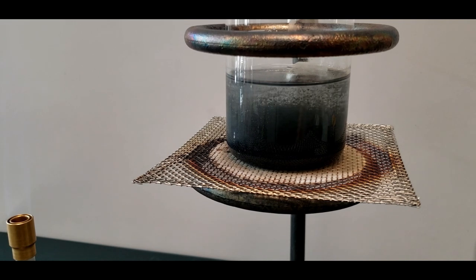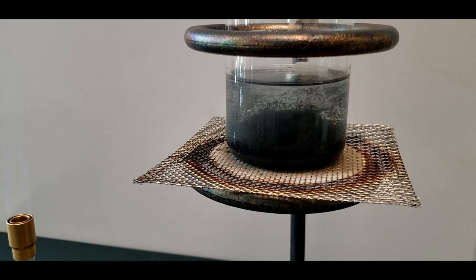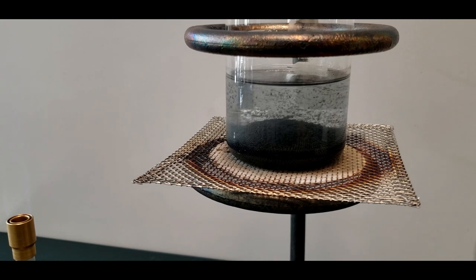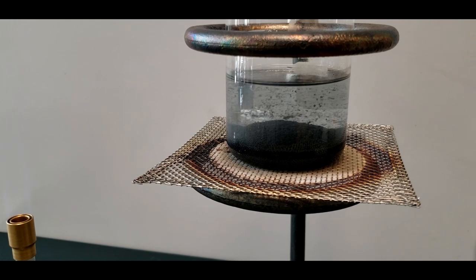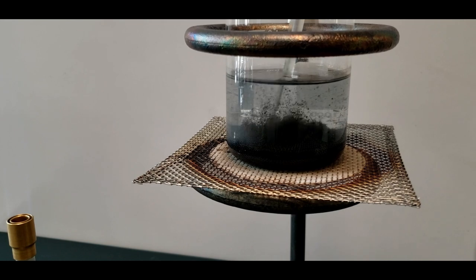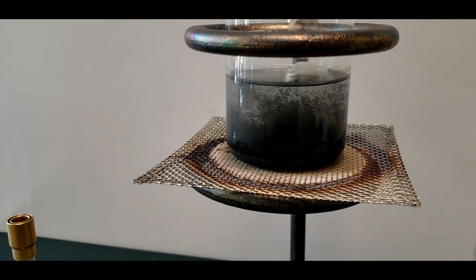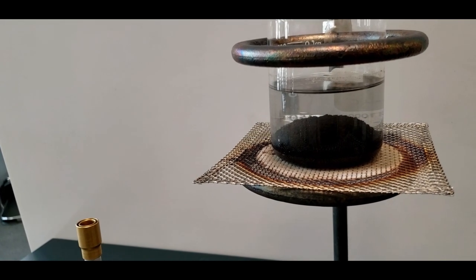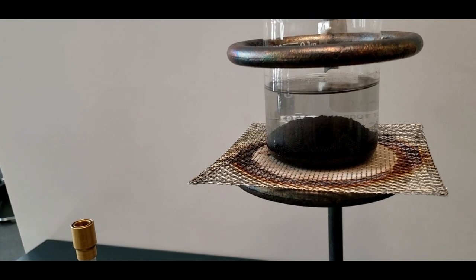As it falls away, as everything's precipitating out, look at the solution above. If the solution above looks like water, you don't see any blue, not even a hint of it, then the reaction is done. I really can't see anything here, but what I'm going to do is heat it for a little bit longer just to make sure. But as far as I can tell right now, you can see that what's clumping at the bottom here, this is all copper oxide. That is our copper oxide. You'll want to make your observation of what you're seeing there.